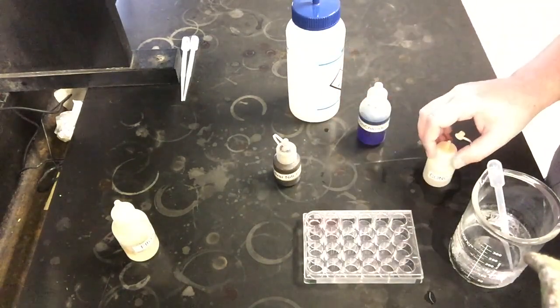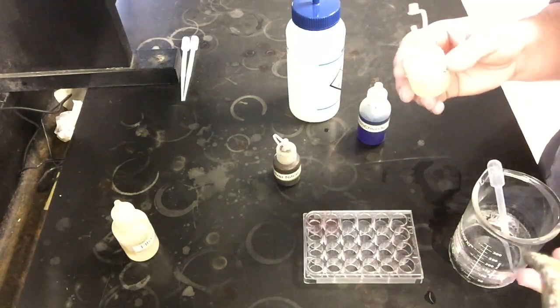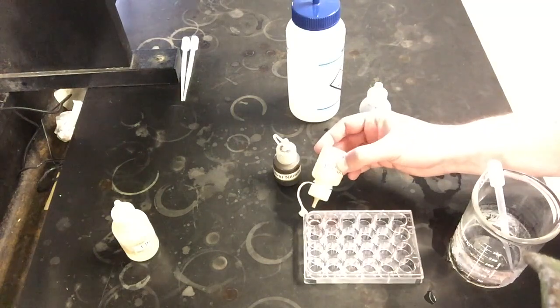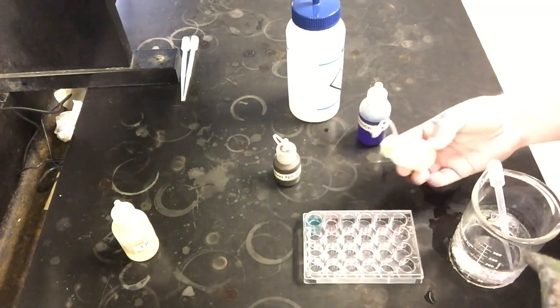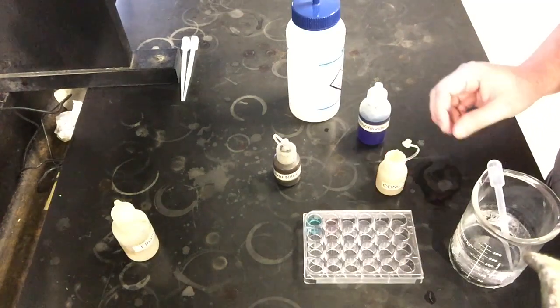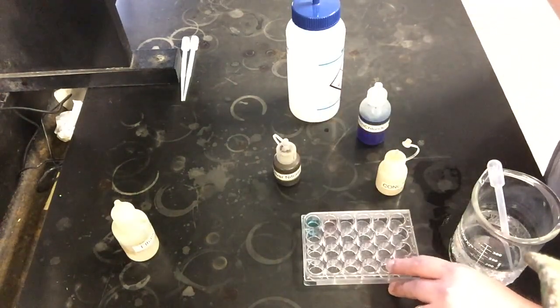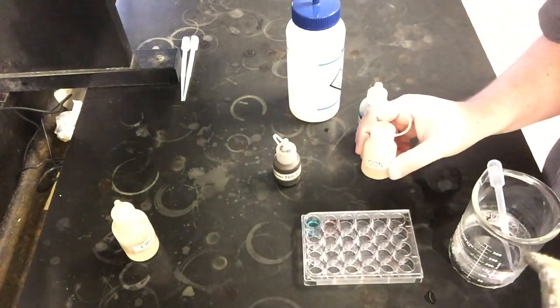And so now what I'm going to do to this first well is add some concentrated hydrochloric acid. And again, I'm not going to explain whether that's a reactant or a product. It's not directly either, but it is going to have an effect that's similar to adding a reactant or product. And as I add the HCl, notice instantly what happens. That color went all the way back to blue. Right? So that first well, adding the HCl, went to the blue color. That means adding HCl helps us make reactants. So that's an important part for adding the HCl.